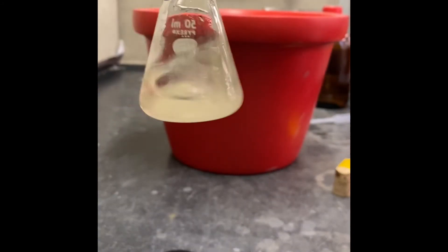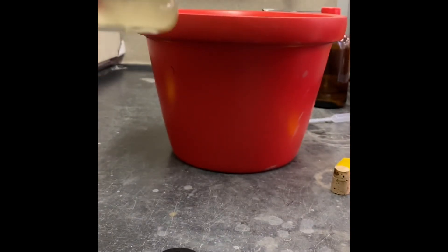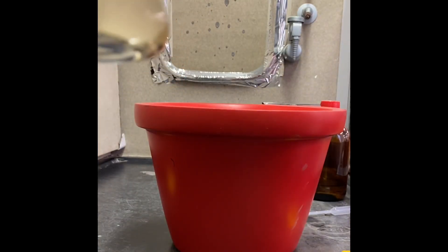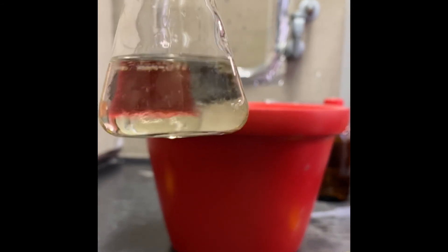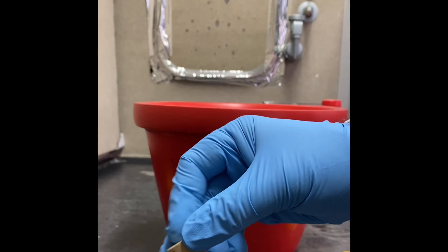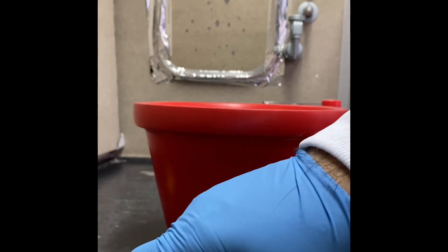That's how it looks like now. You're going to leave that at room temperature for 24 hours and it's going to be ready. After that, you're going to get our benzoin product.